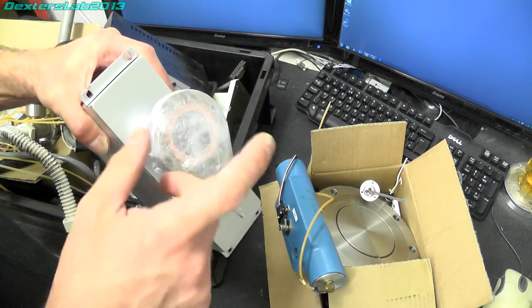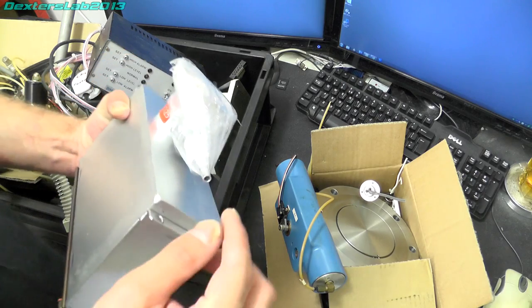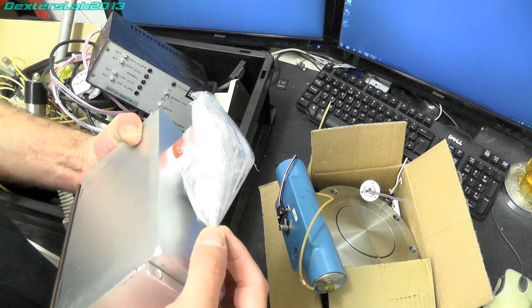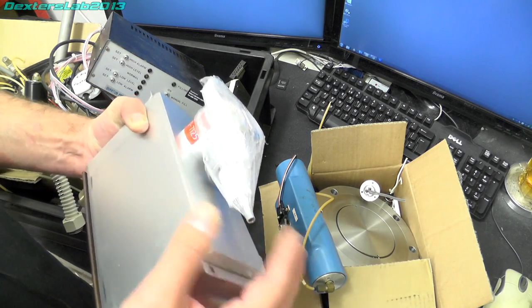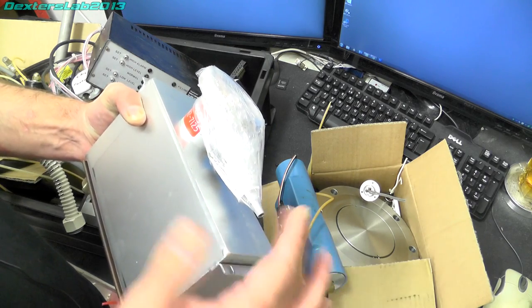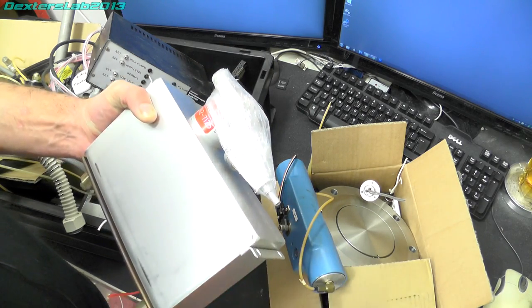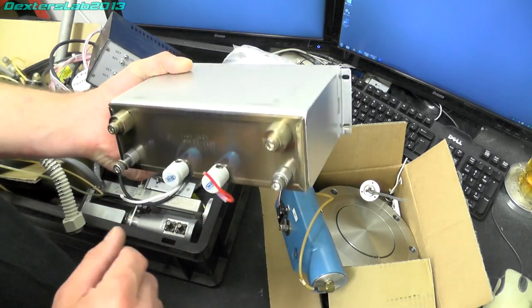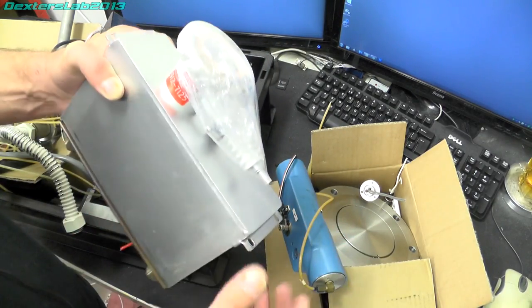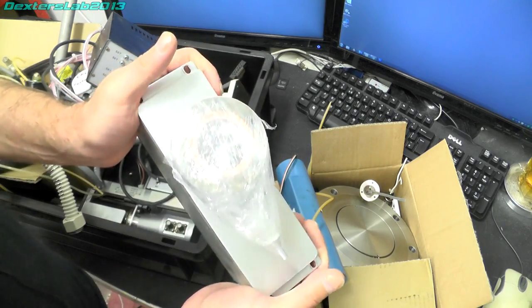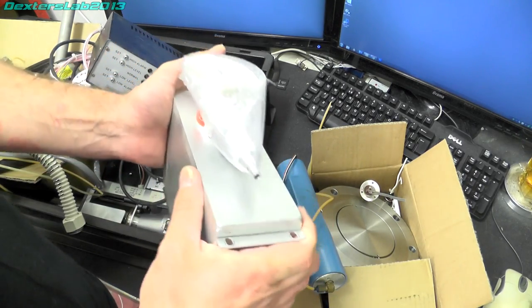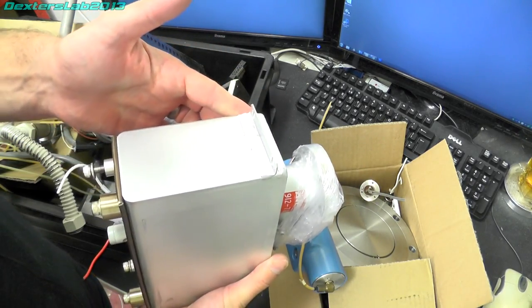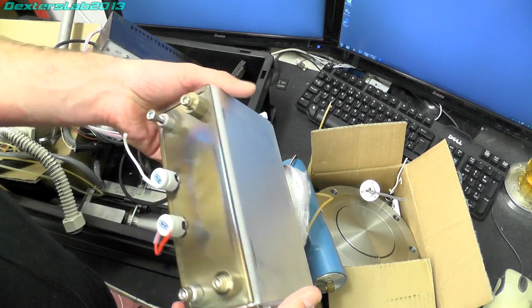We've got the port on the front here and that is the high voltage electrical connection. You normally put around about 5-6 kV on there and that with a bit of science inside ends up absorbing any of the stray gases that are in the system and increases the vacuum.